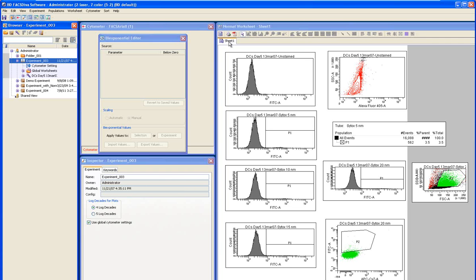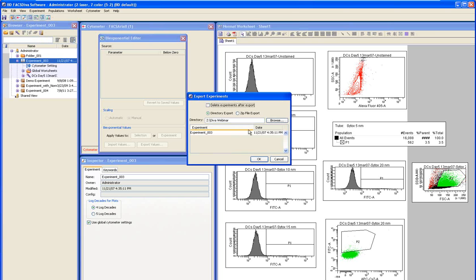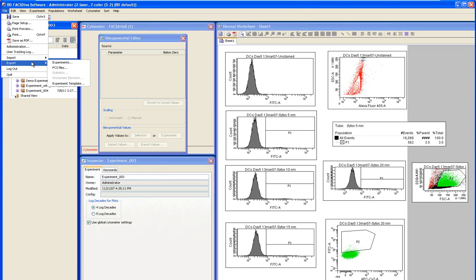Okay, so you can see it's set up with histograms, with markers, gates, and a contour plot. And what I'm going to do is go and do my 2 exports again. So export experiment. We'll go to experiment 003. Let's replace everything. And we'll do another export of the data files.